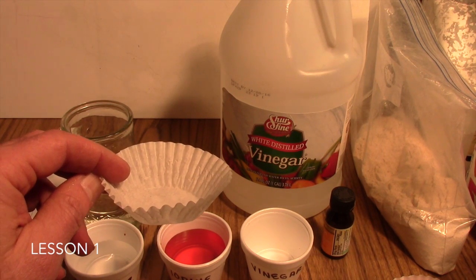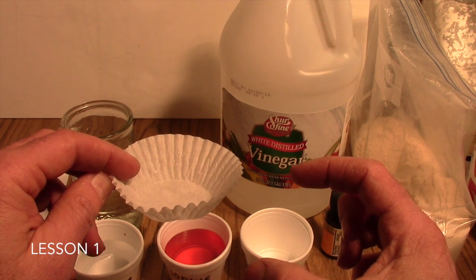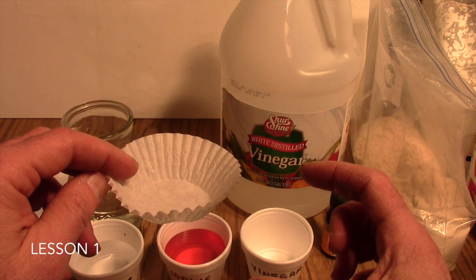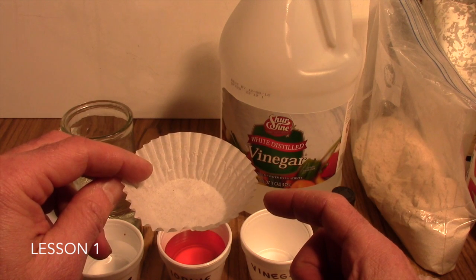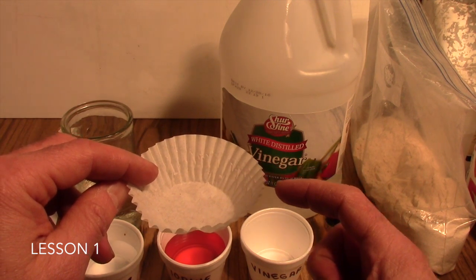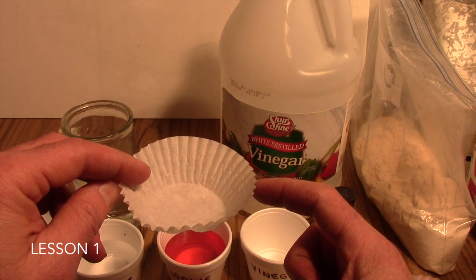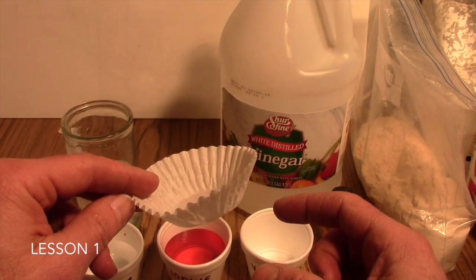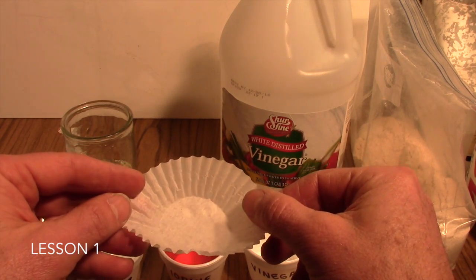If you have lids from yogurt, plastic lids from yogurt cups, or like sour cream containers, those work nice. If you have access to lab equipment, petri dishes, especially the divided petri dishes, are handy for this, or even the lids from petri dishes work fine. Another alternative is just a piece of aluminum foil. Paper plates, styrofoam little paper plates work nice too. These cupcake liners are pretty darn cheap, and you'll be using several with your students.